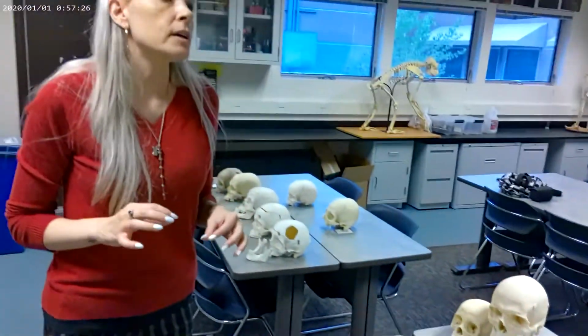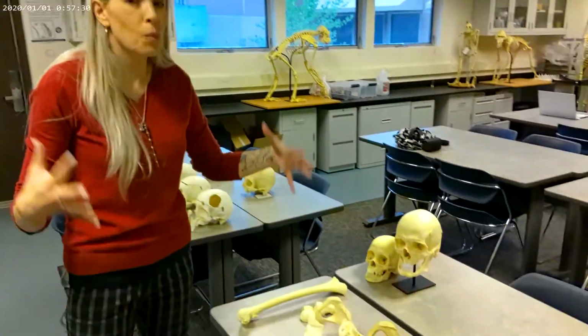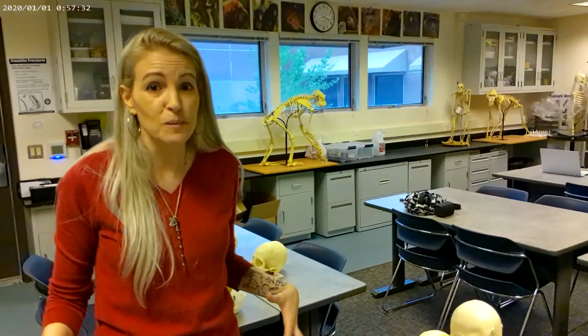The first thing we want to look at is going to be the epiphyses. These are the growth plates in humans. When we're born, we have a ton of different bones in our bodies than we have when we're adults because they fuse together over time.